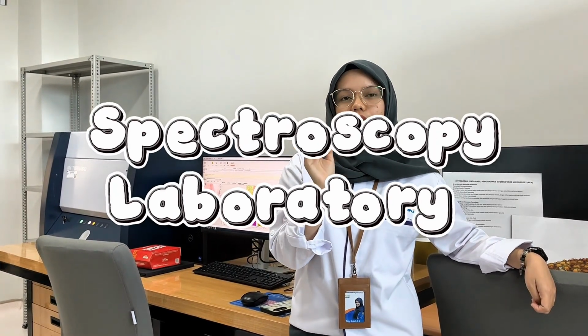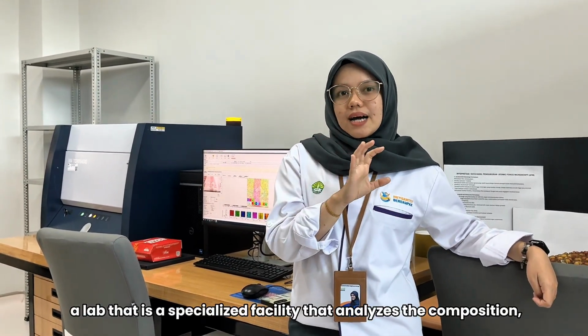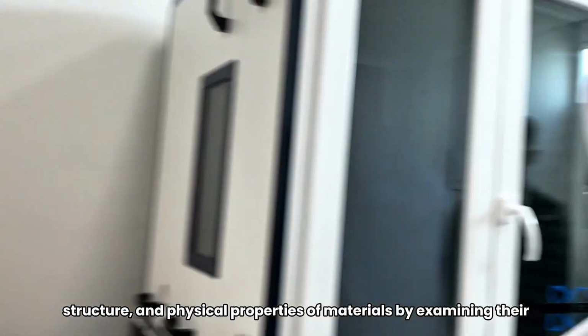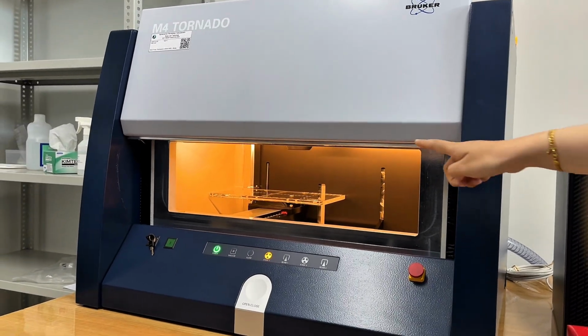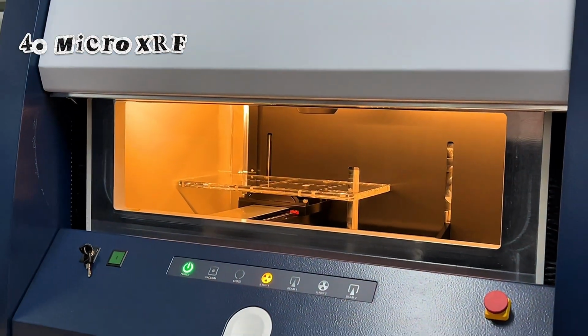Now we are in the spectroscopy laboratory, a specialized facility that analyzes the composition, structure, and physical properties of materials by examining their interaction with electromagnetic radiation. One of the equipment in this laboratory is called micro XRF.